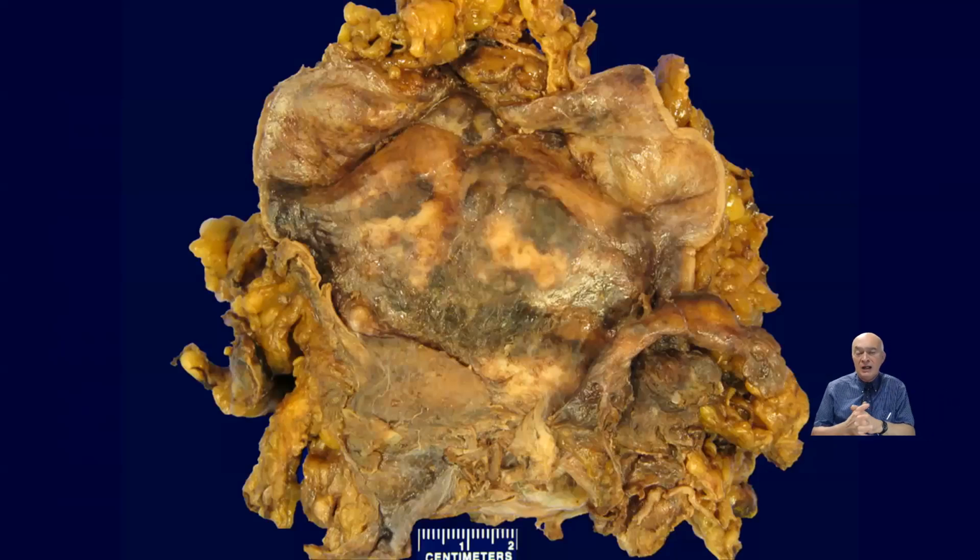So I try not to call them tumor or malignancy. We can just call them nodular lesions, more descriptive in regards to what they look like grossly, because many times, as I said, the tumor is already gone, and the only thing that we have is the sequela of the surgical procedure. So it's better not to get involved in describing the nature of these lesions in the gross examination.